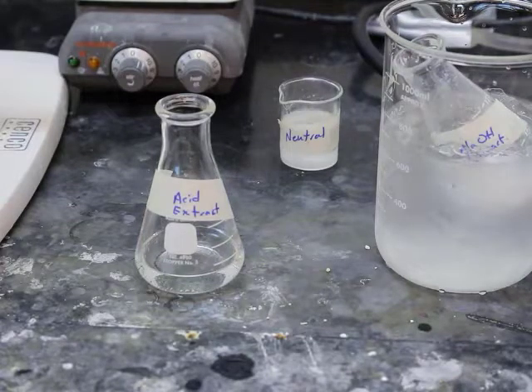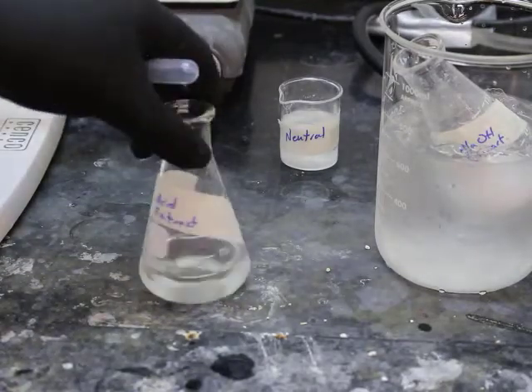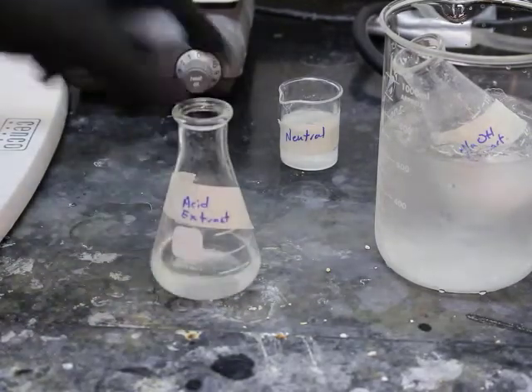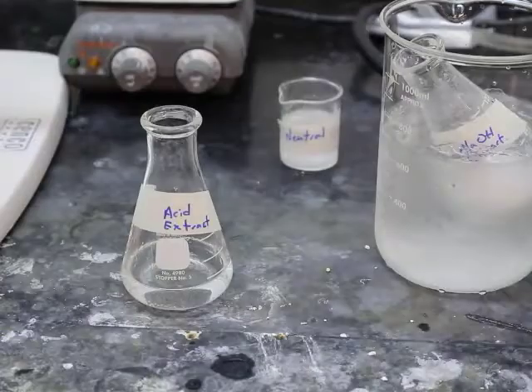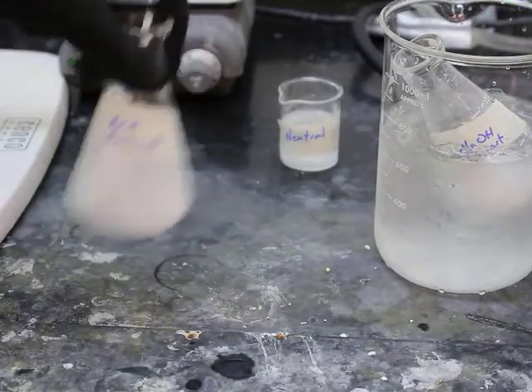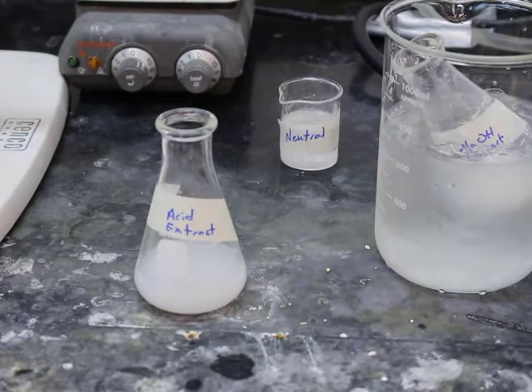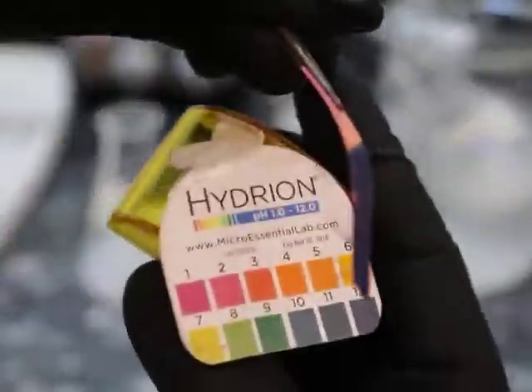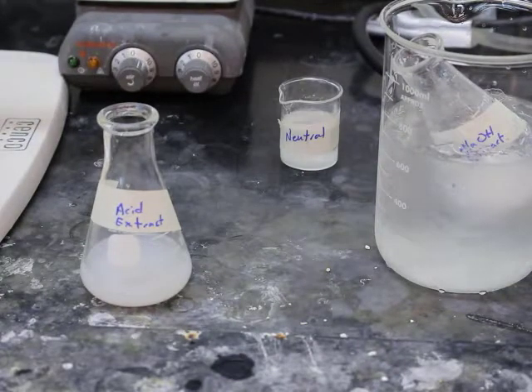And so now with the acid extract, we are going to add base, specifically 6 molar sodium hydroxide. If you notice, with each addition of sodium hydroxide, we see a white solid go about. All right, pH tested, it was still acidic. So then added some more sodium hydroxide. Now you see all that white cloudy stuff. So yet again, pH tested it. That indigo color tells us that yes, it is a basic pH.